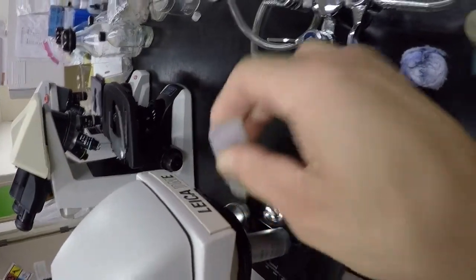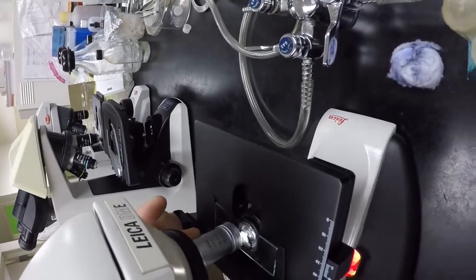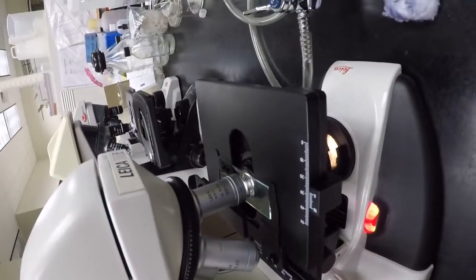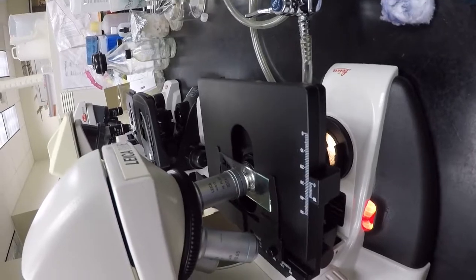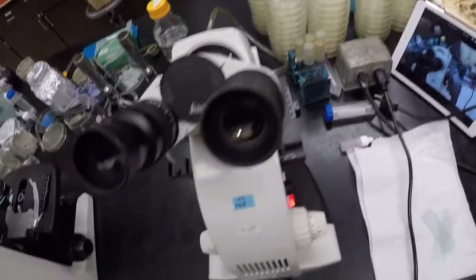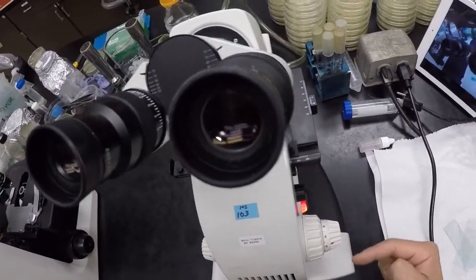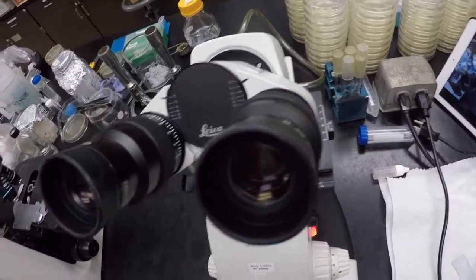drop that right on your sample. Nice drop right there. Not too much, but you know, some. And then rotate the 100 in. And I like to wiggle a little bit and then watch it go in. And the oil should be making contact with the lens and the slide. Okay? And then now again, on the top, 2 times forward, 2 times back, and then it should be there. And it's parfocal, right?